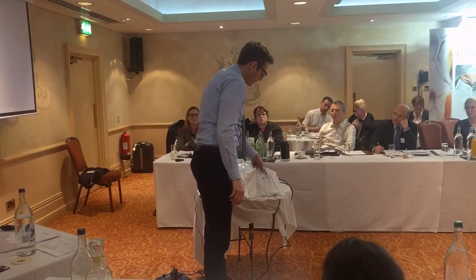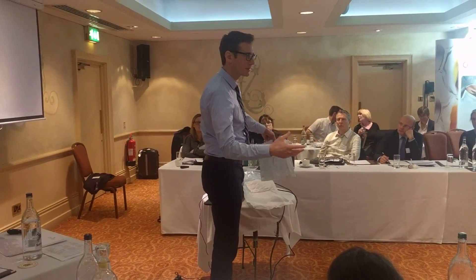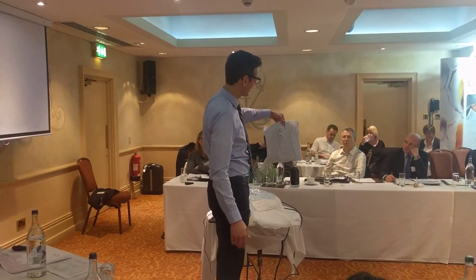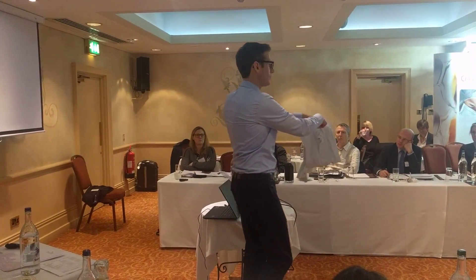While taking the garment out of the packaging, we have different garments — some are prepared in a special way, some are not, which is the bigger challenge. We try to touch them only on the inside, and we try to avoid touching our undergarments, any furniture, or the floor.